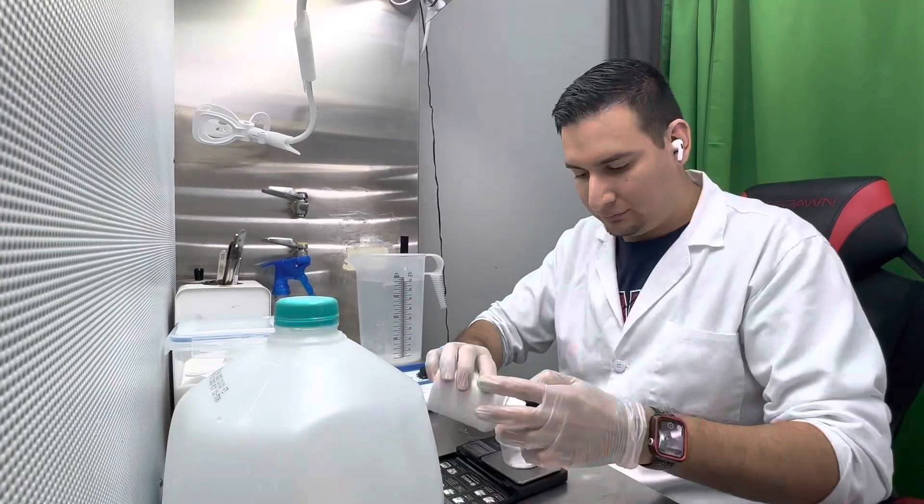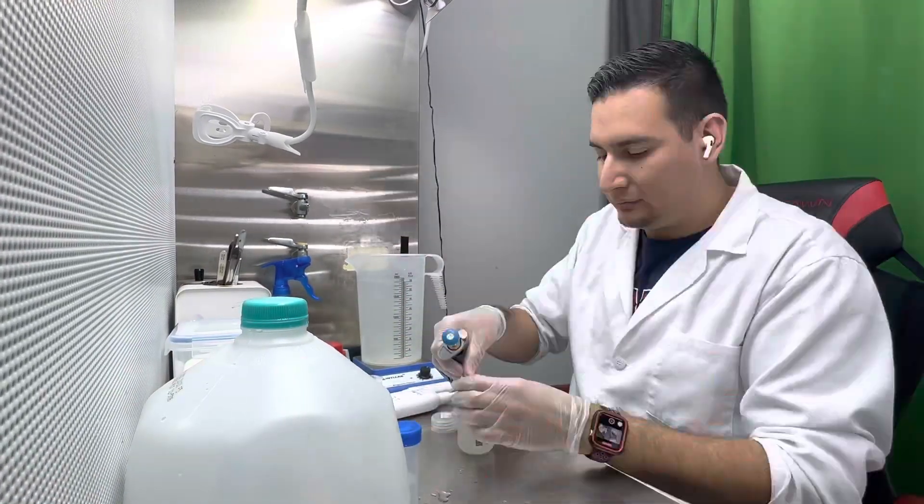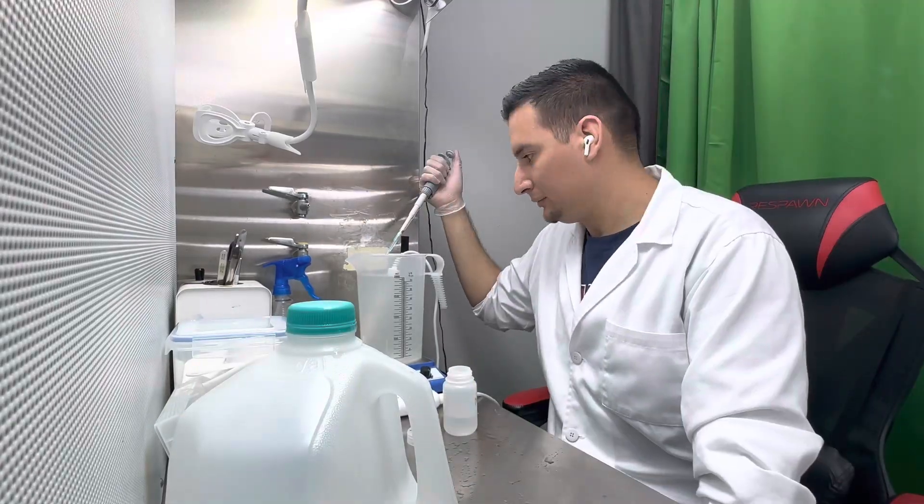After that, I just place the media in my other jars, then sterilize those in the pressure cooker as well.